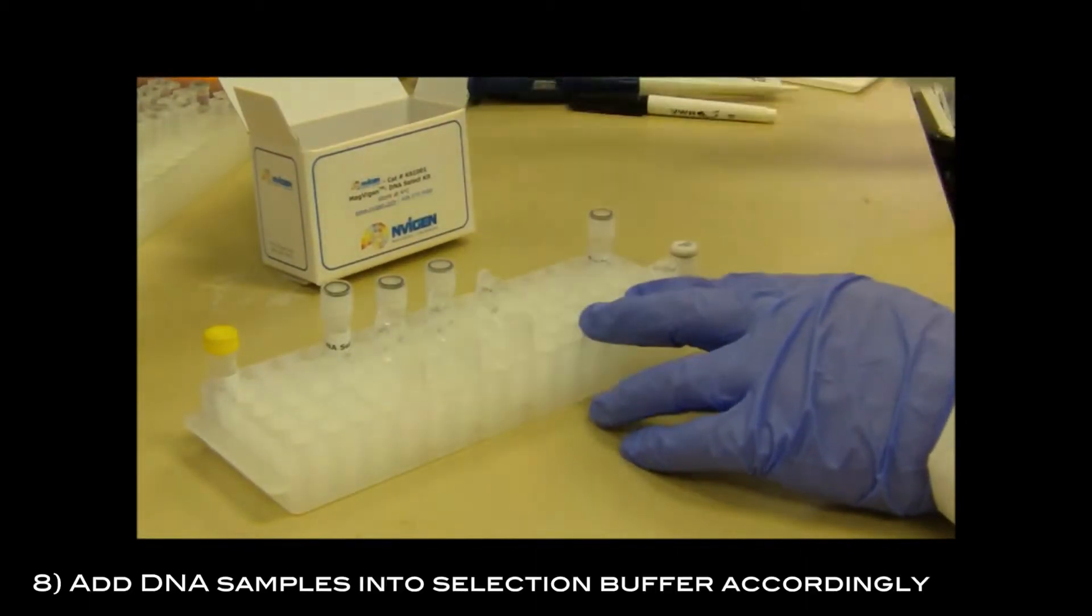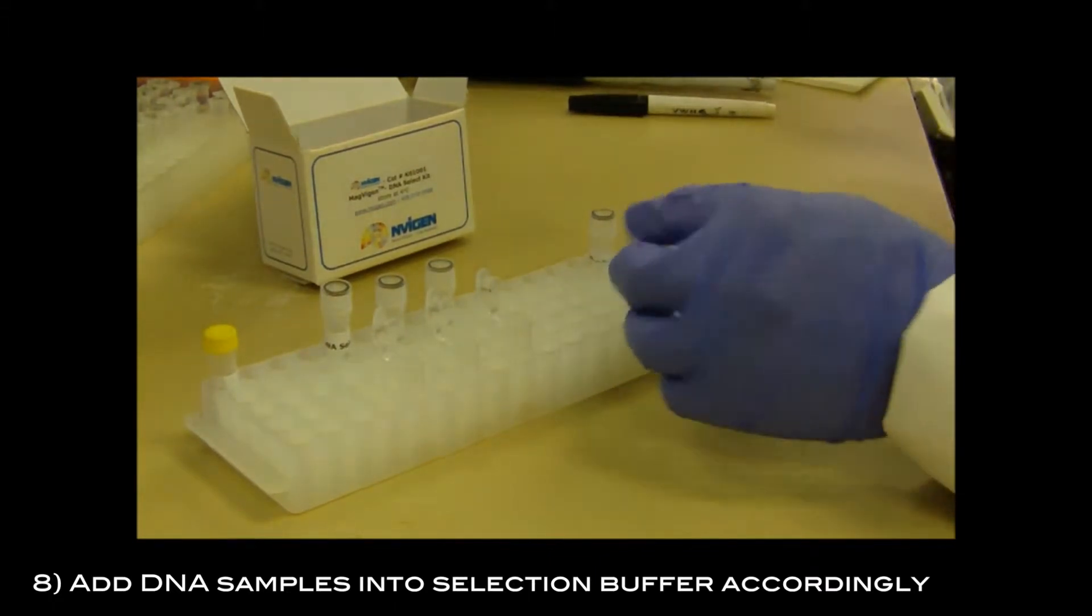Add the DNA samples into the selection buffer accordingly and vortex to mix well.